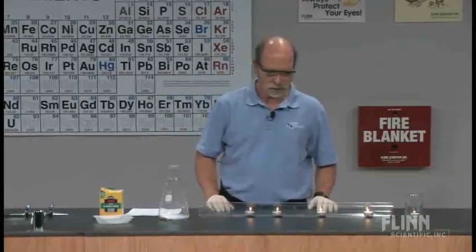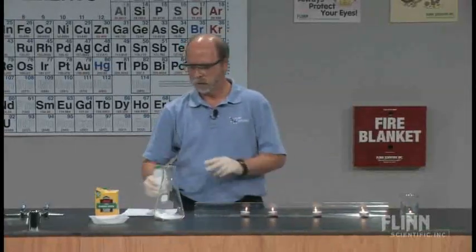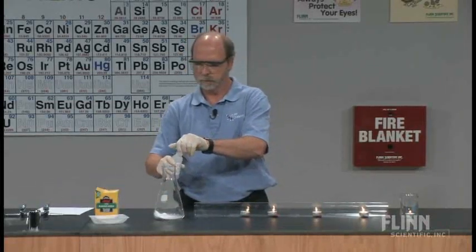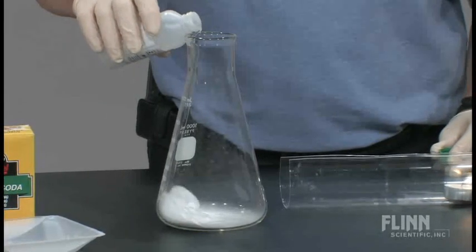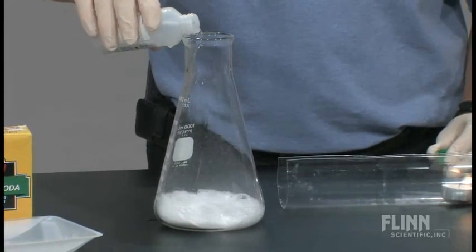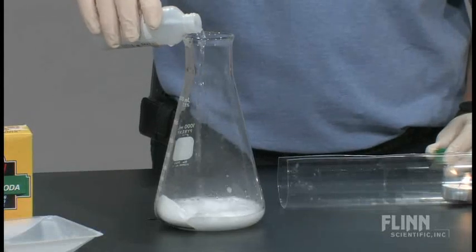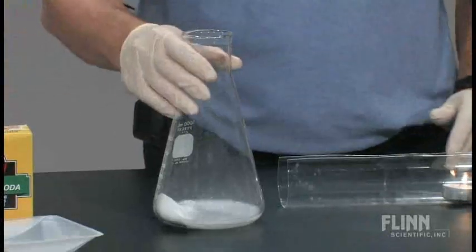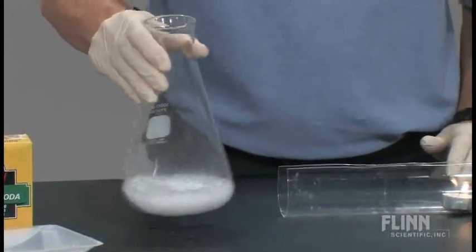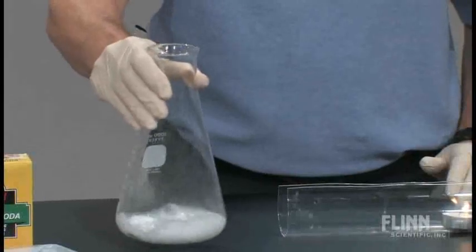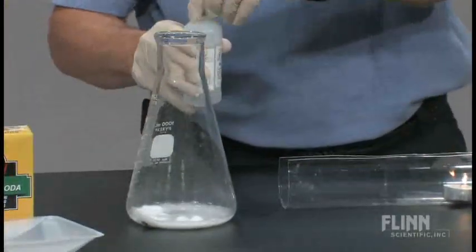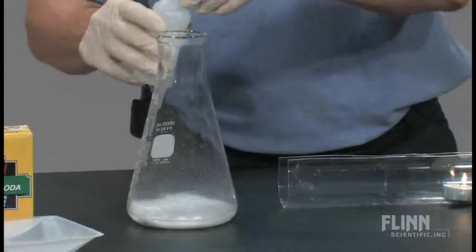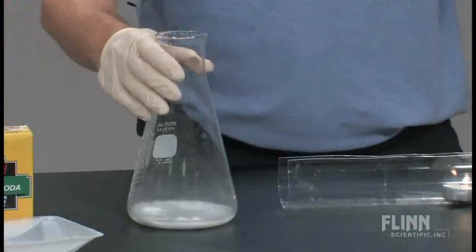Having lit the candles, I'm now going to react the baking soda with the hydrochloric acid to generate my carbon dioxide. I'm going to react a little bit more to ensure that all of the air has been pushed out of the flask.